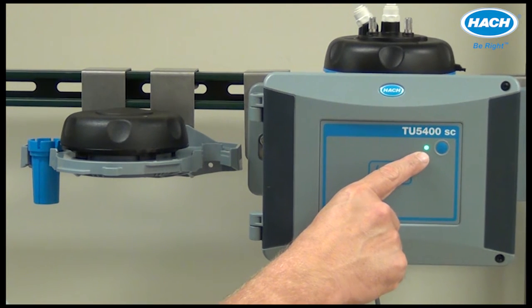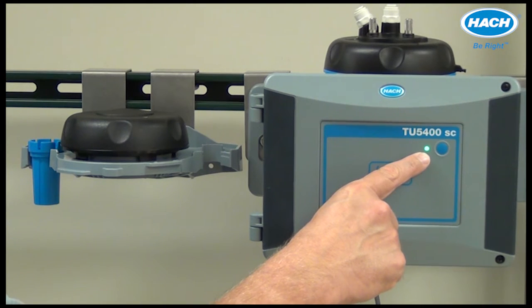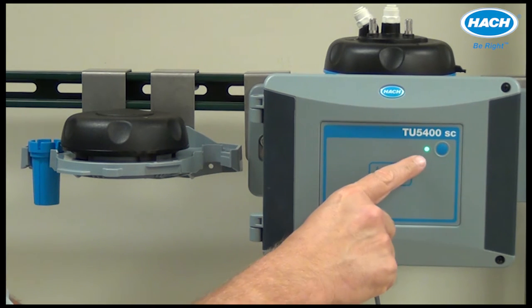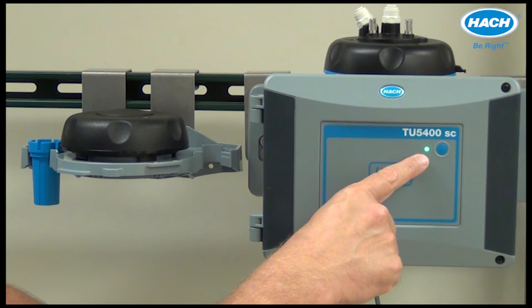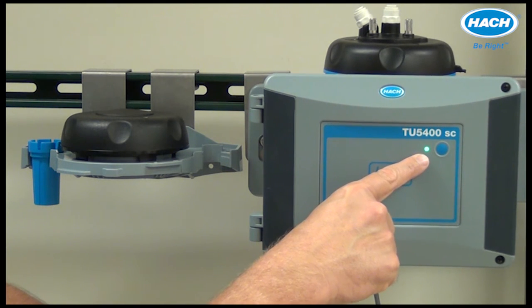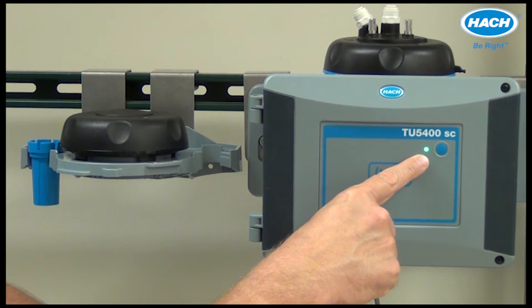Generally speaking, the green color indicates that the instrument is operating without issue — no warnings, no errors, and no reminders. Yellow indicates a sensor warning. Red indicates a sensor error. And blue indicates that the instrument is in a calibration or verification activity.